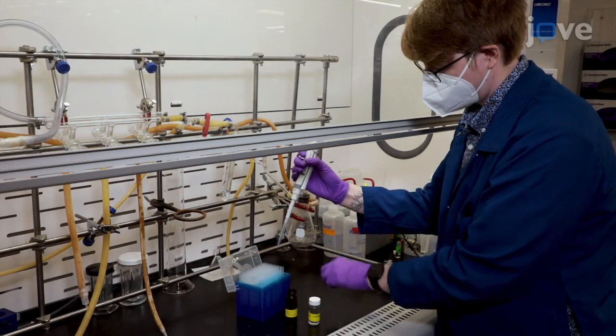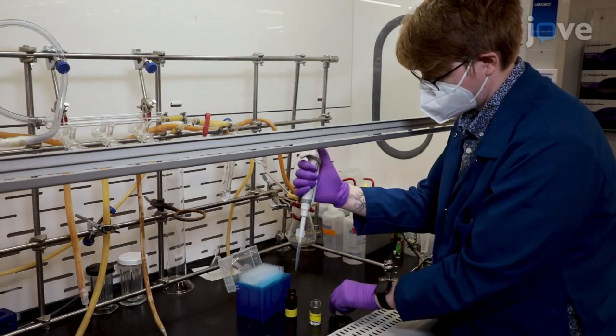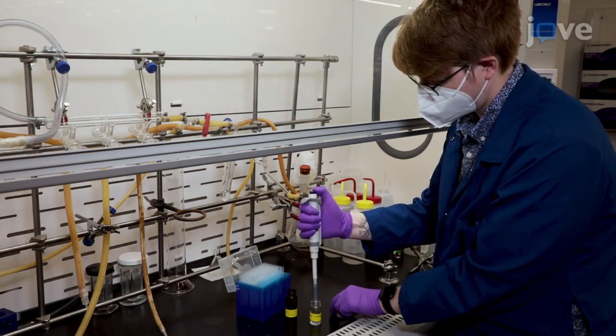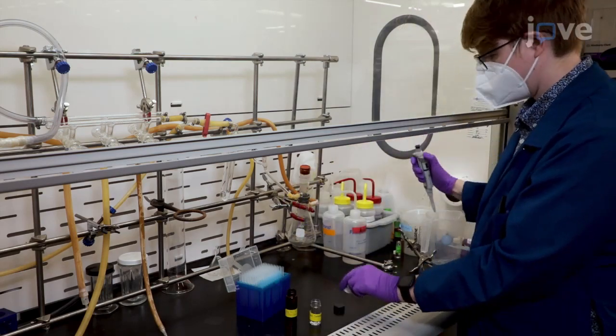To begin, add the appropriate volume of lipid stock solution into a clean glass vial to achieve a final vesicle concentration of 2.5 mg per milliliter after rehydration.